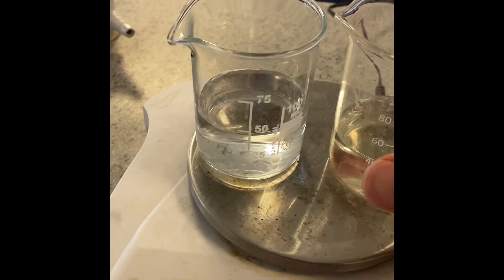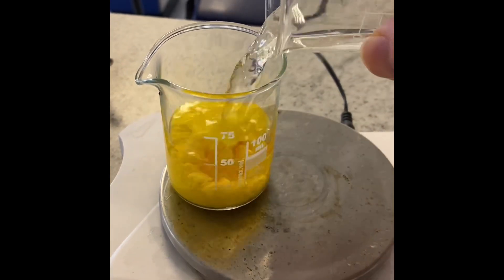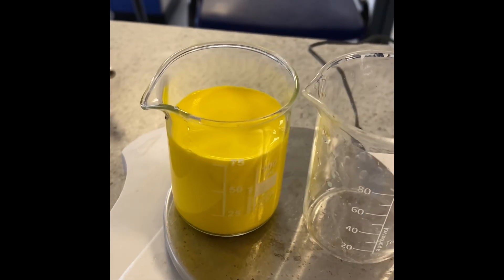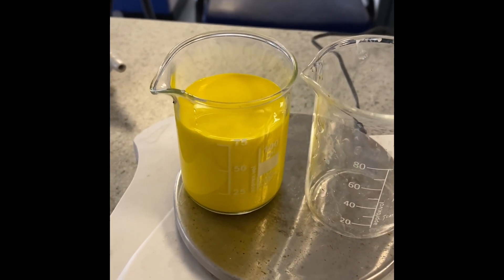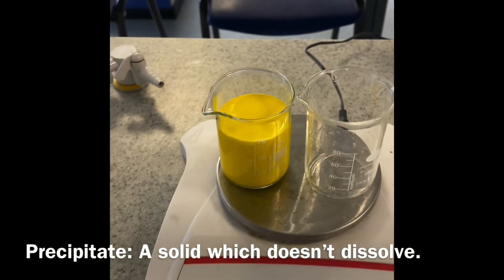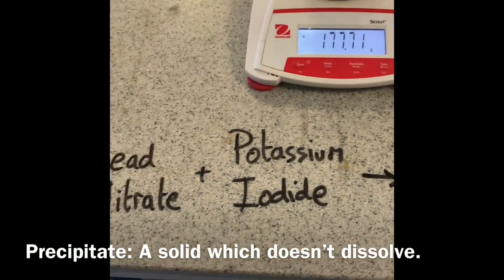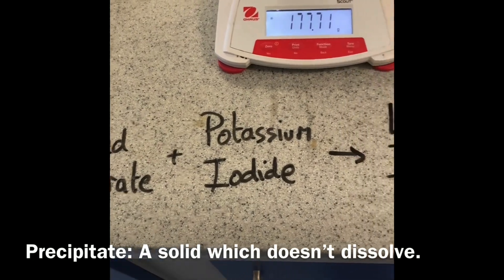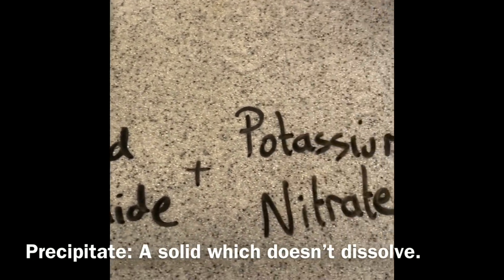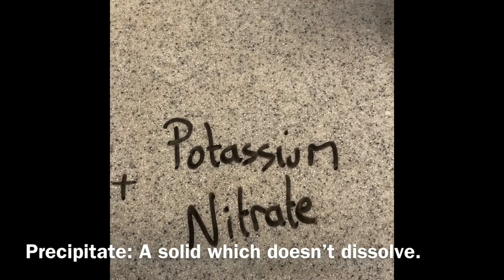If I pour one into the other, we see there straight away a brilliant yellow precipitate formed. So if we look at the equation for that reaction, lead nitrate reacts with potassium iodide — the precipitate is lead iodide, and then potassium nitrate is also formed.